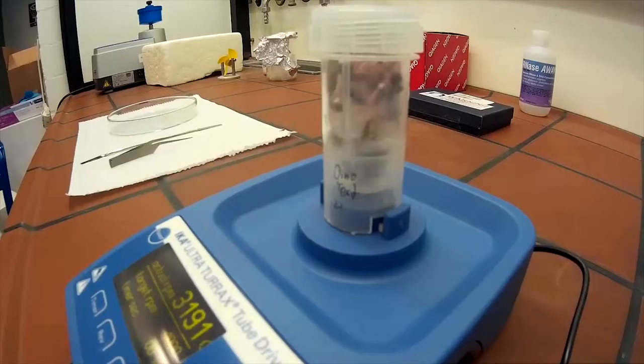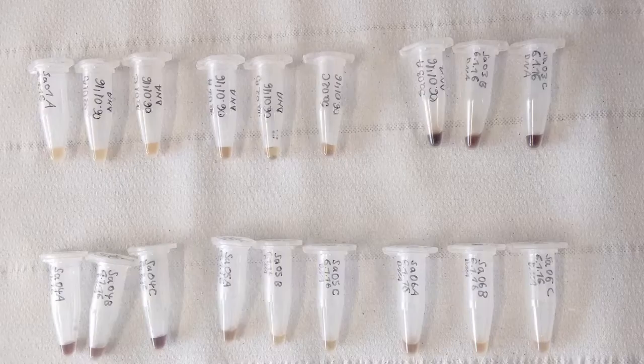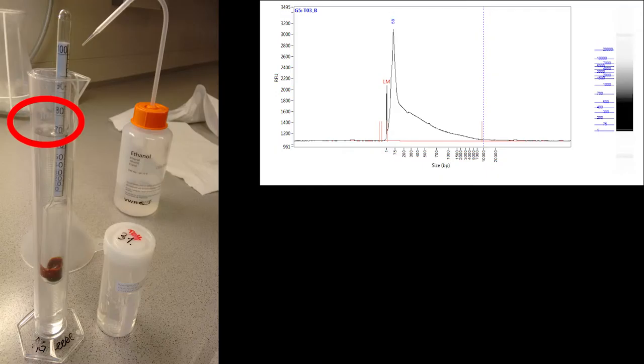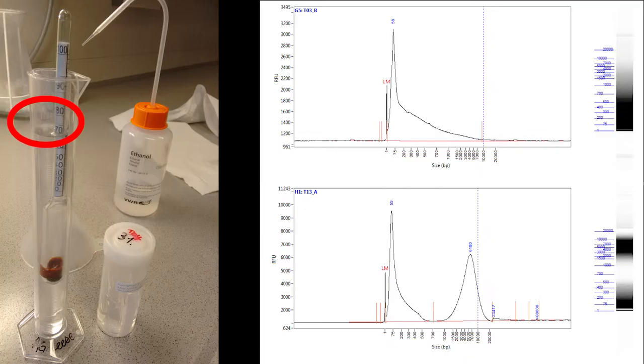In this video we will show you how we dried and processed the samples for standard DNA salt extraction. The samples were collected in 2013 and were stored in the freezer. Unfortunately, the ethanol content in the tubes was only about 60-70% and thus sometimes the DNA of the samples were very degraded.